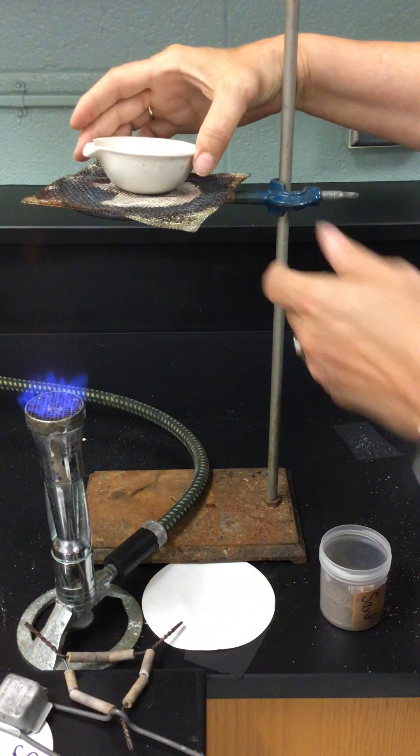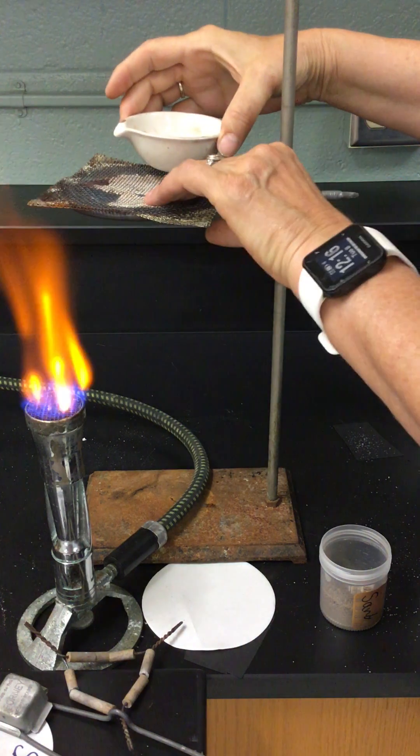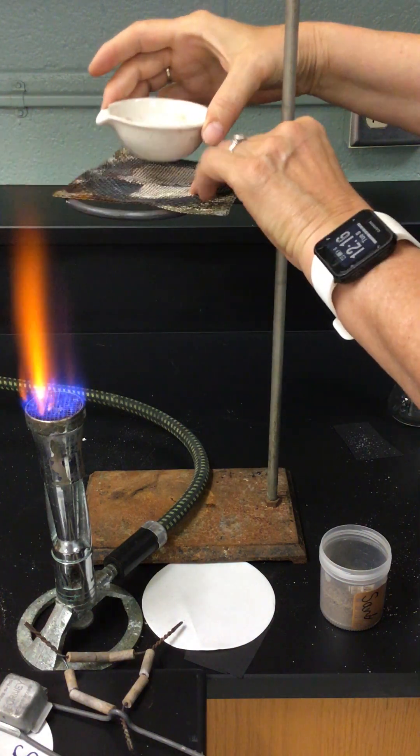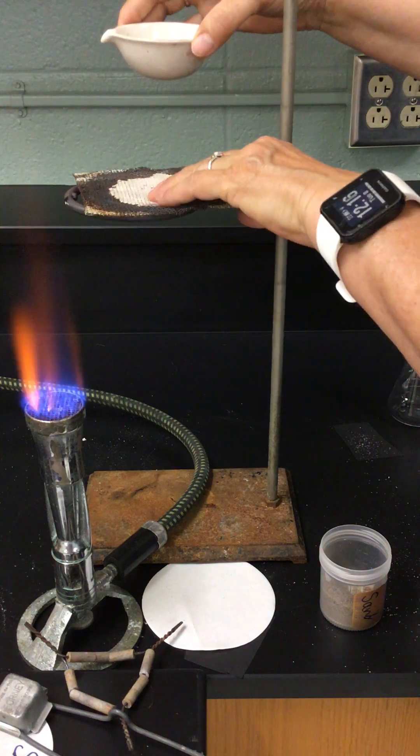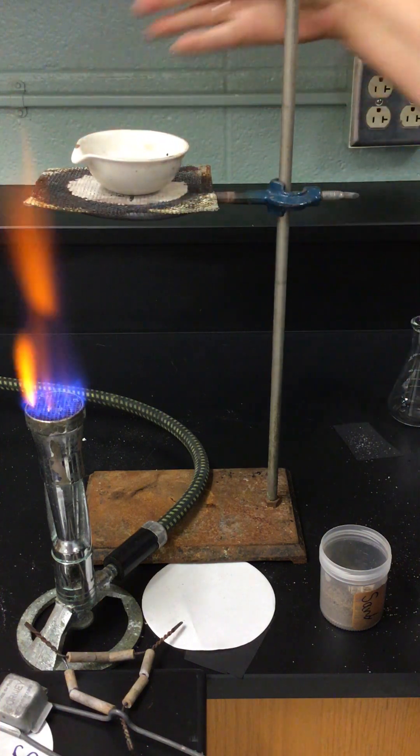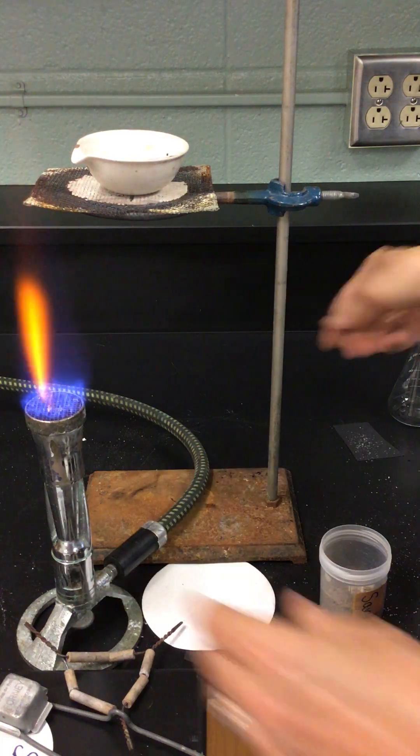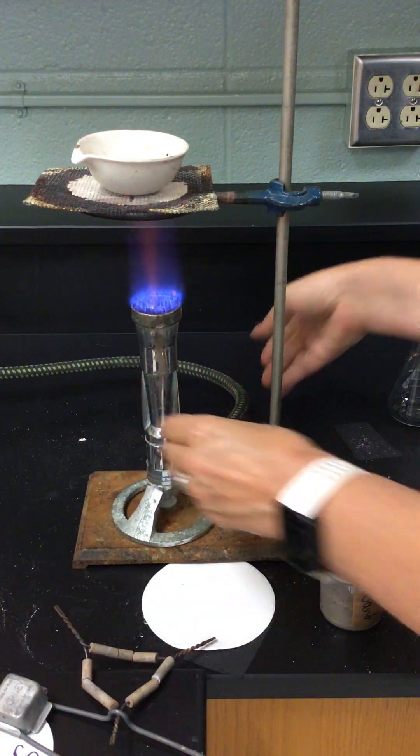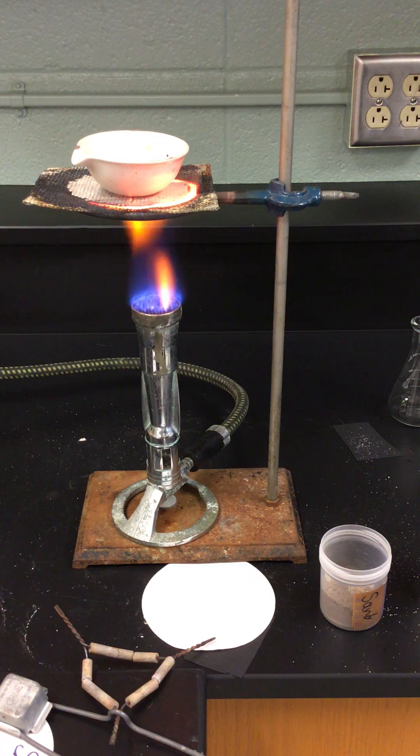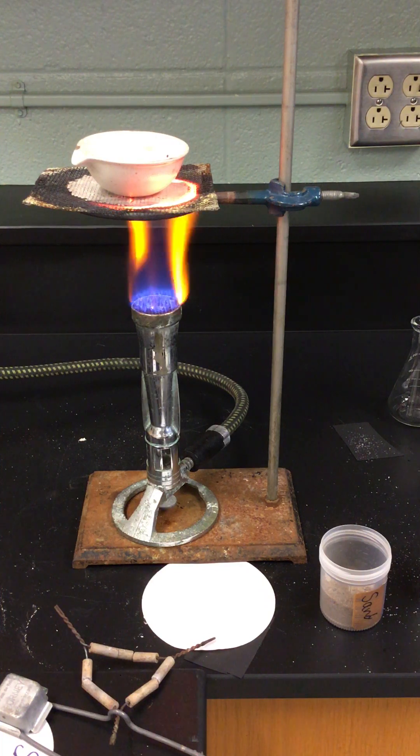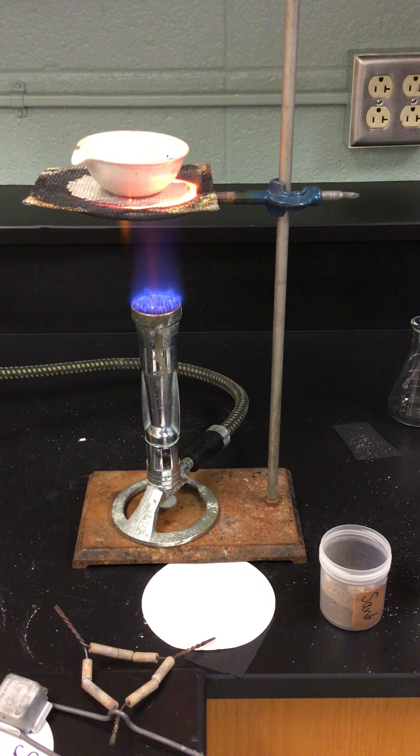So I'm going to set this up here, try to set it so it doesn't look like it's going to go crashing to the ground, so it's somewhat stable. Then I'm going to place this under and we're going to let this evaporate. I just had a thought. If I was going to do this again I would have had one that I'd let finish evaporating instead of making you watch this.